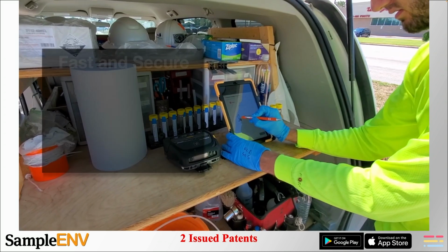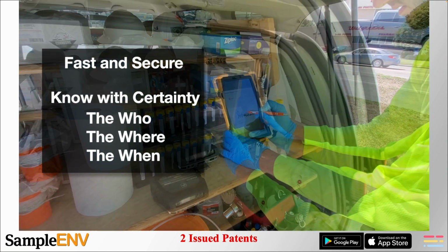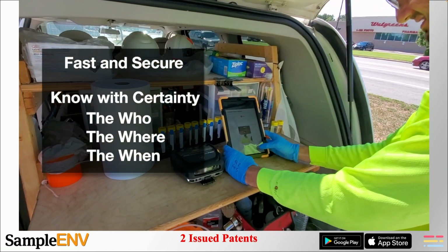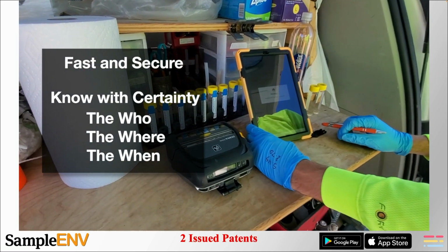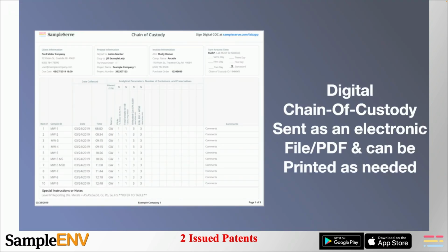custody. You can see here Jonathan is collecting a sample. He's already logged in under his username and password. He signed his name and he's taken the selfie. So we know it's him. Then he's going to hit the submit button and it's going to print his labels for him. When you've completed your sampling for the day, you'll have the ability to generate that chain of custody. It can be printed if needed and sent digitally as a PDF and as an electronic CSV file.